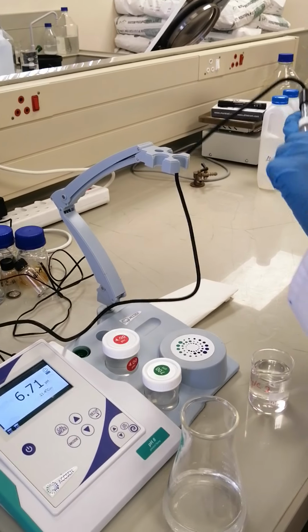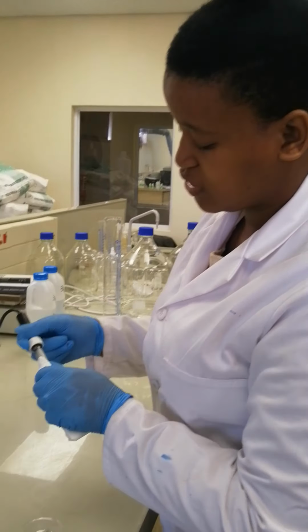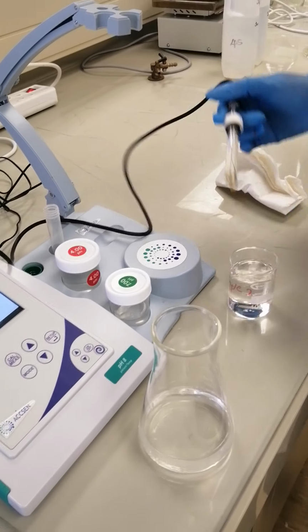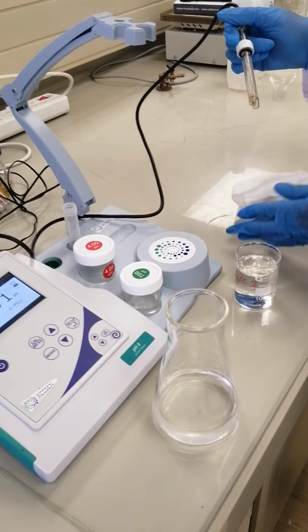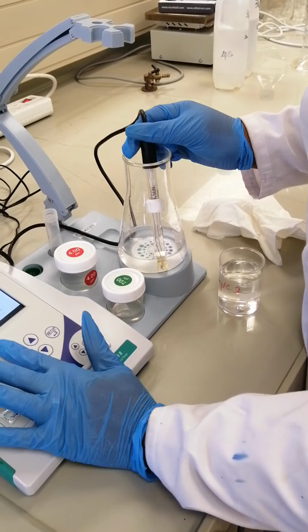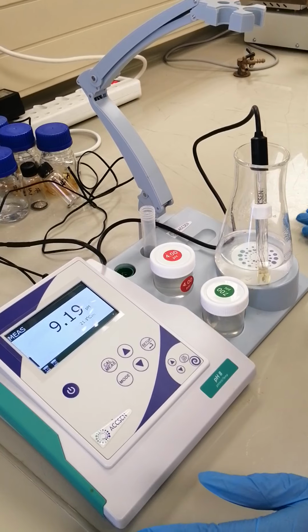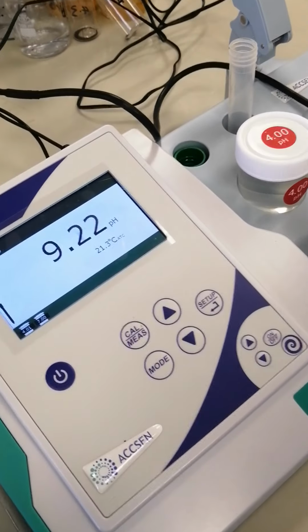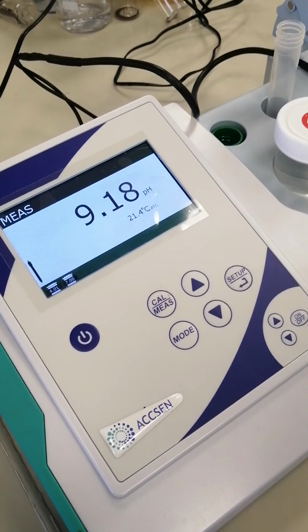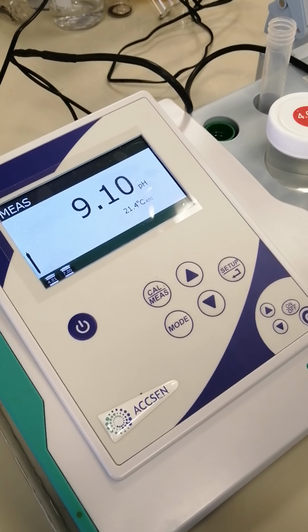So now we are going to start doing our measurements for pH so that we can see which indicator we should start with. Firstly we rinse our electrode, wipe with a paper towel, then we immerse our electrode and press measure. So we'll see what is the pH of our water sample. As you can see, still processing. So let's wait a few minutes until it gives us a smile. If we get the smile, we will know that our pH is what?